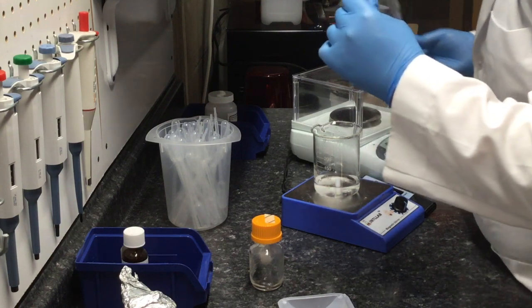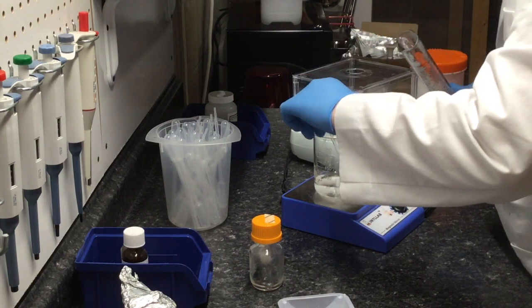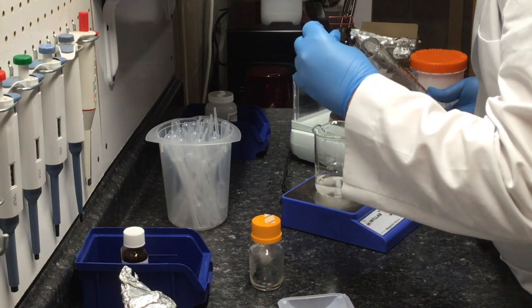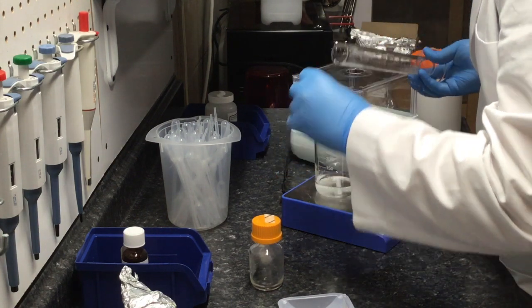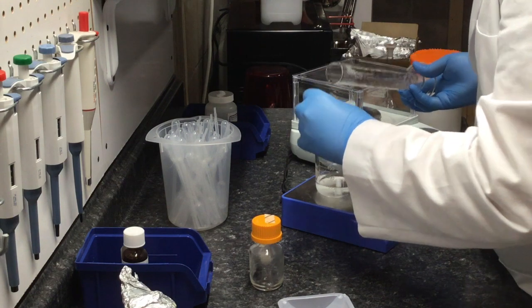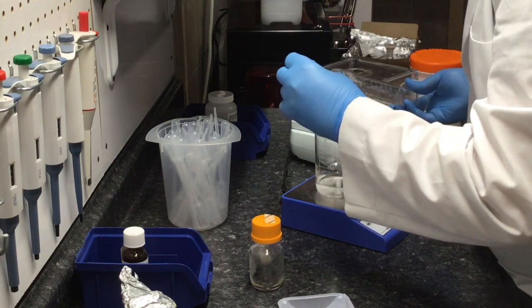I am now going to ensure that all the solution from the graduated cylinder has made it into the beaker by rinsing it with the same water from the beaker while stirring it.